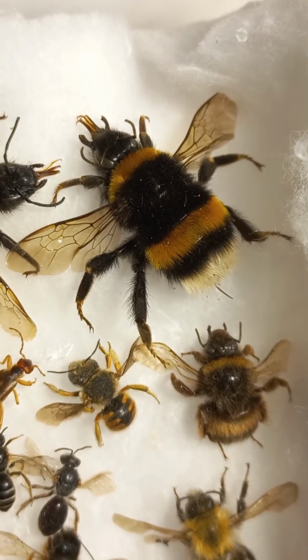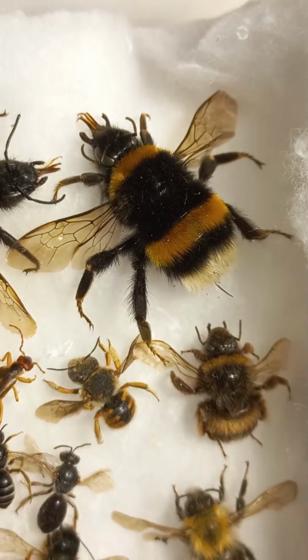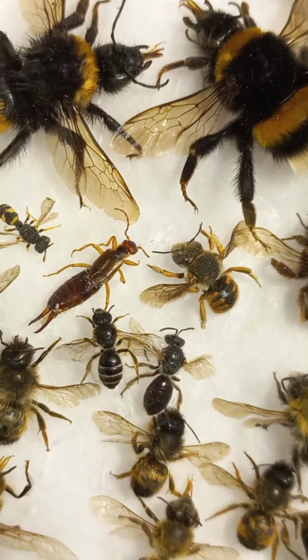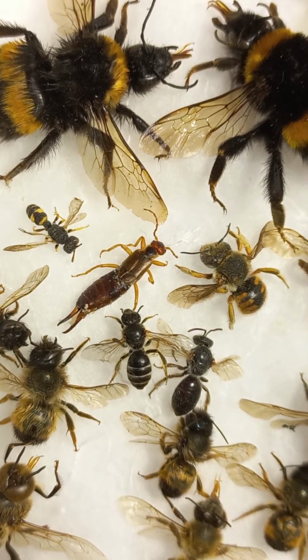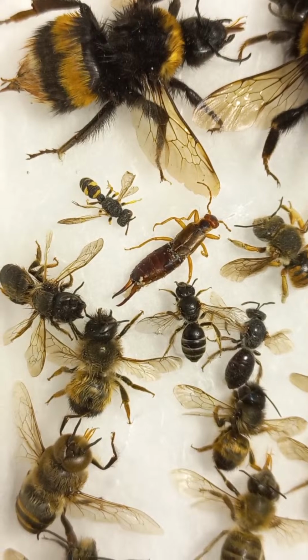And here, down where you can watch, you can see a small bee, which is yellow in color. This is Anthidium, belonging to the family Anthophoridae. Maybe this is Anthidium or Anthophora, I'm not quite sure. Some small bees here belong to the family Halictidae, the smallest one. One yellow wasp belongs to the family Eumenidae, a weevil hunter, a solitary wasp.